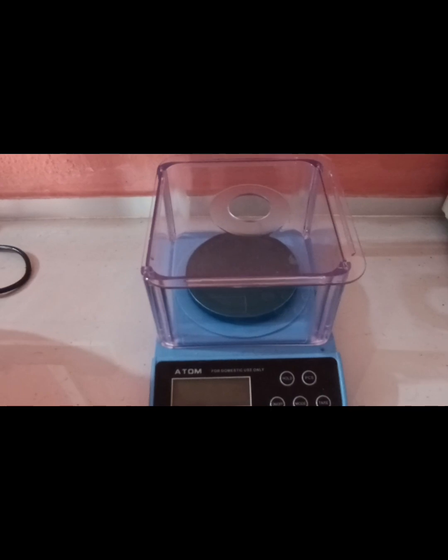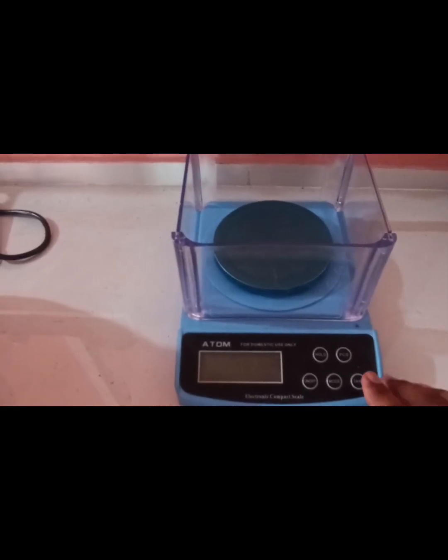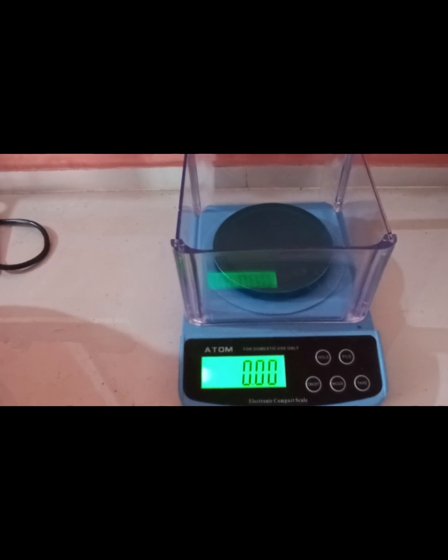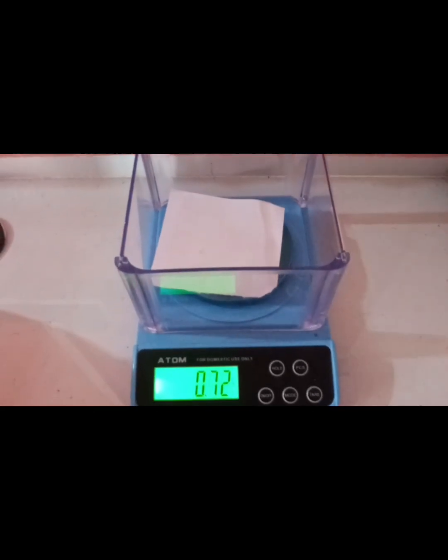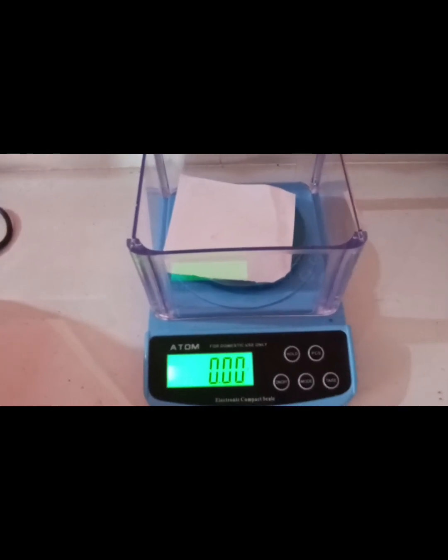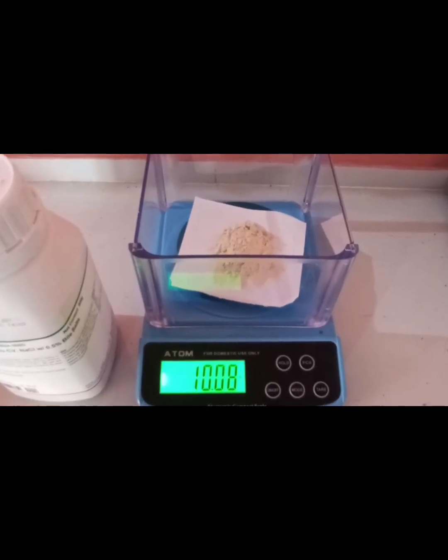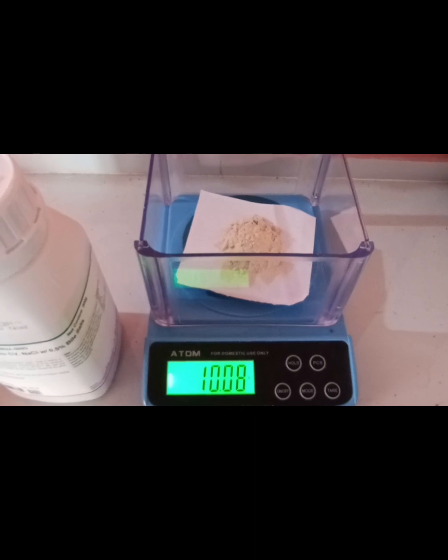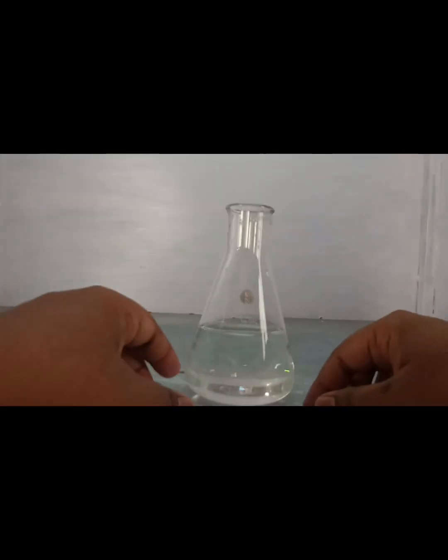These are the weighing machine. At first, we open the lid and switch on the power. Then put a paper on the balance and set it to zero. We are measuring the agar powder. Finally, we take 10 g of MacConkey agar powder for the preparation of MacConkey agar.